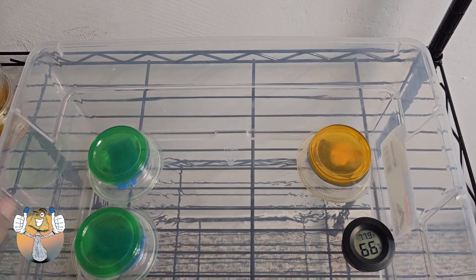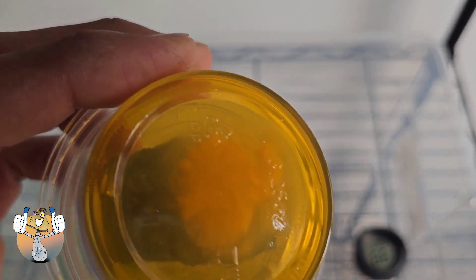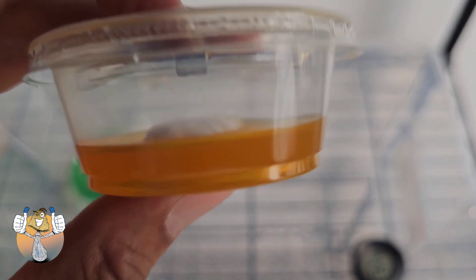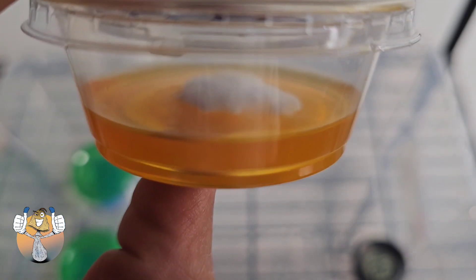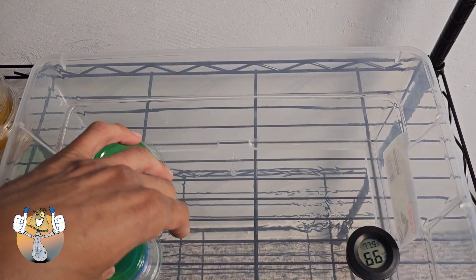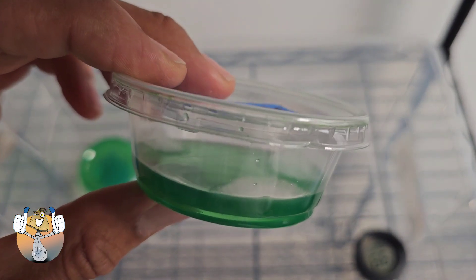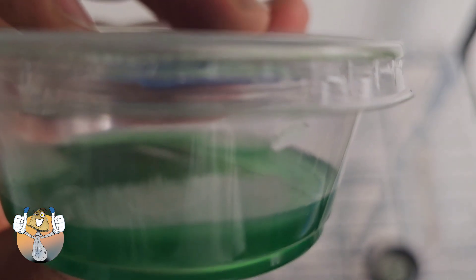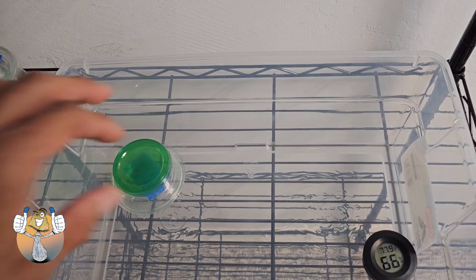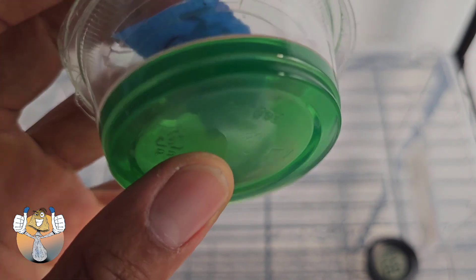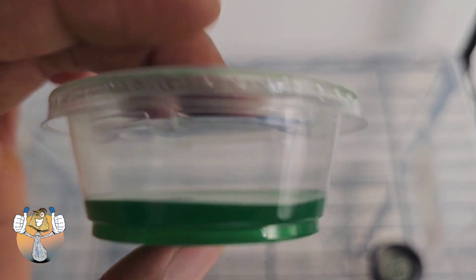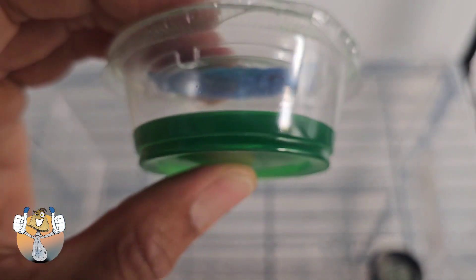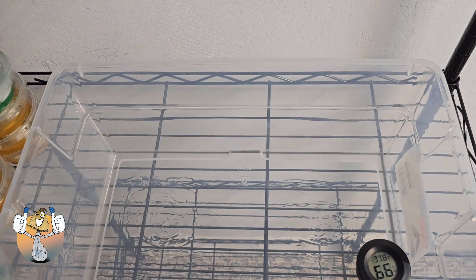Okay, that's the last one. Very nice. And I did not make any of these agar plates. I ordered these from Etsy. Yeah, I ordered it from there. Very nice. And I wanted to show you this lid. I didn't show you on the last clip, but look how this lid is folded up on me and we still have nothing out of there. But it's fine. I'm not expecting much. Look at that. So air is definitely getting in there. All in all, I'm super excited with my results. Cannot complain one bit. First time, I am hype. Let's go.